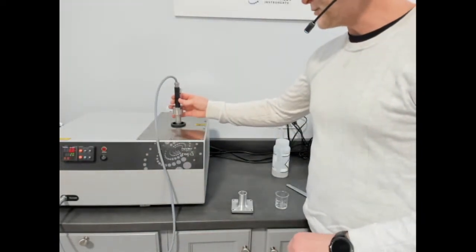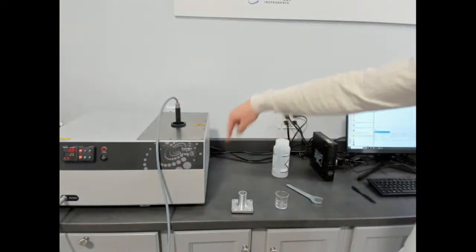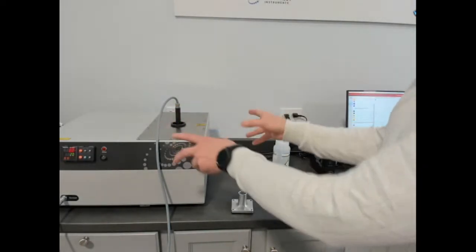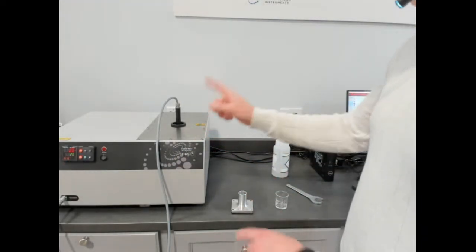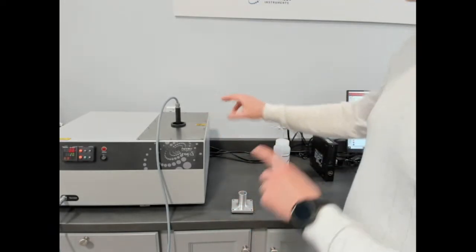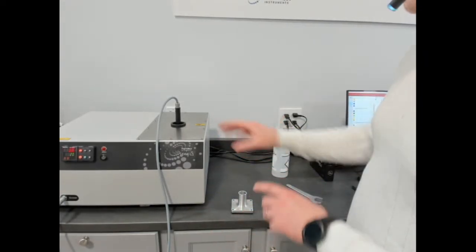We're going to load this into our temperature platform. Before I switch to the software and show you what that looks like, let me talk a little bit about the temperature platform. This one is thermoelectric chilled, so there's no external cooling. It's all internal cooling on this particular model that goes from 10 degrees to 200. The other models are 0 to 300, minus 45 to 300, and minus 160 to 300. Those other three models have variations of liquid chiller, or variations of liquid nitrogen to cool them. But it's all in the same dimension of controller box.